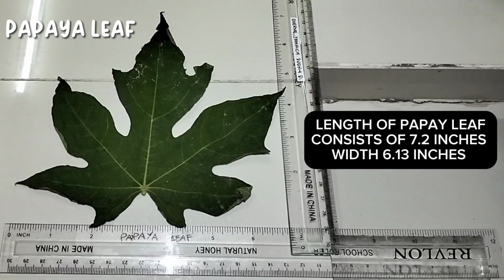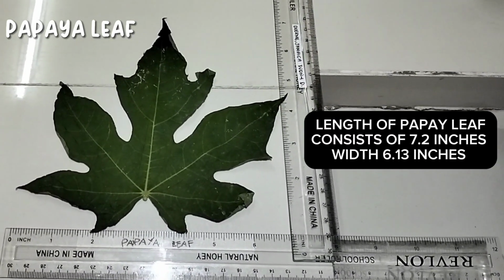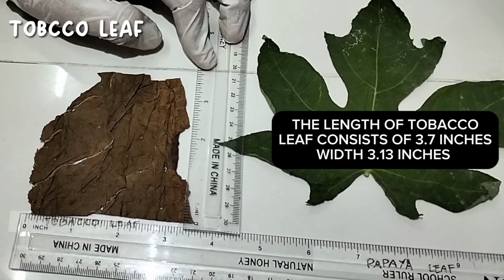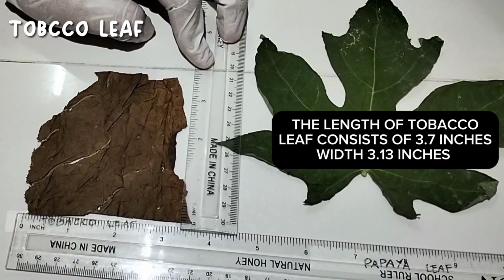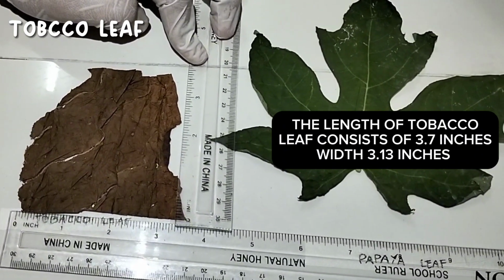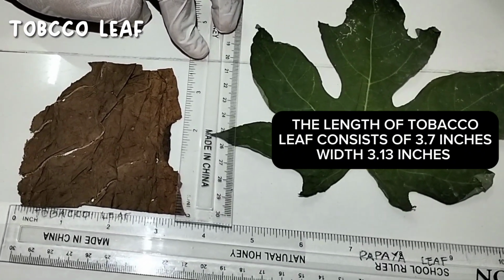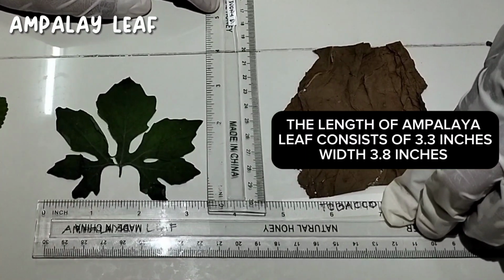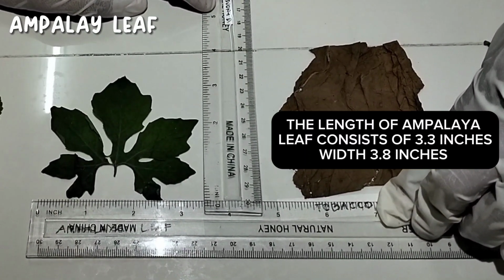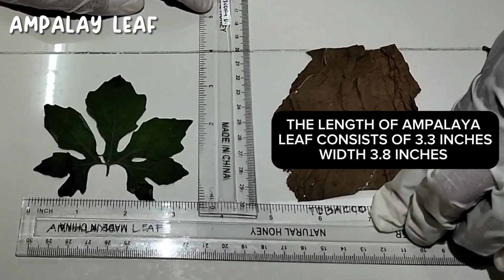The length of papaya leaf consists of 7.2 inches and the width is 6.13 inches. The length of tobacco leaf consists of 3.7 inches and width consists of 3.13 inches. The length of ampalaya leaf consists of 3.3 inches and the width of ampalaya leaf consists of 3.8 inches.